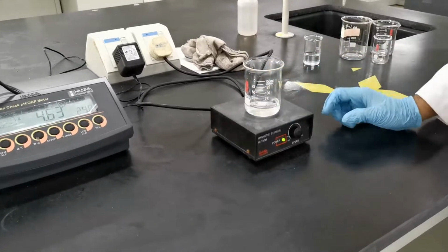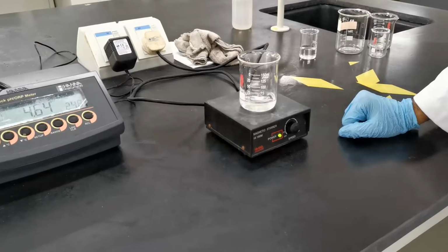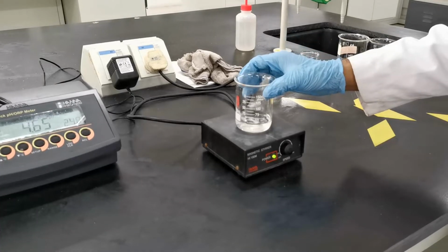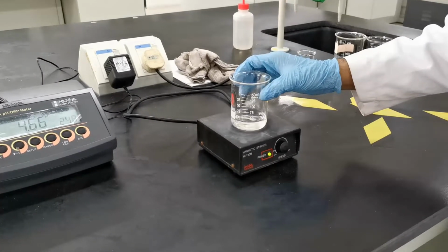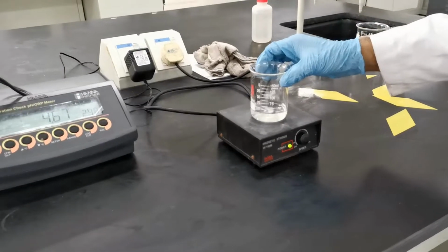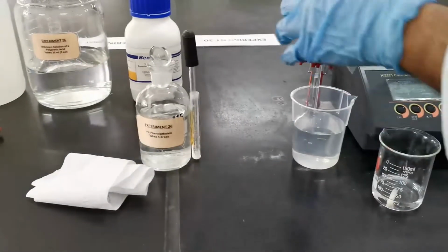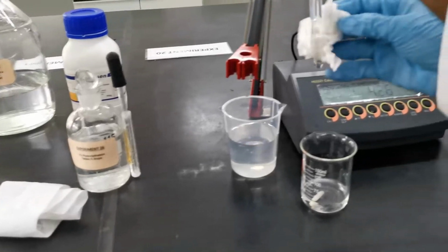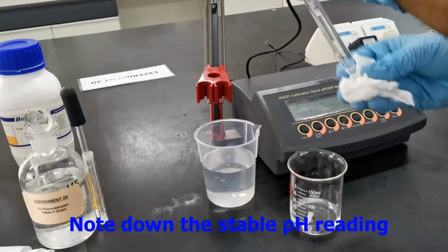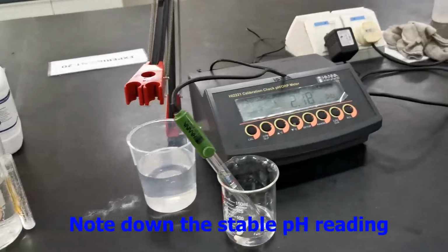So mix the solution under magnetic stirring, and the next step would be to measure the pH using the pH meter. Likewise, get the electrode, make sure the bulb is clean, and immerse it fully until you get a stable reading.